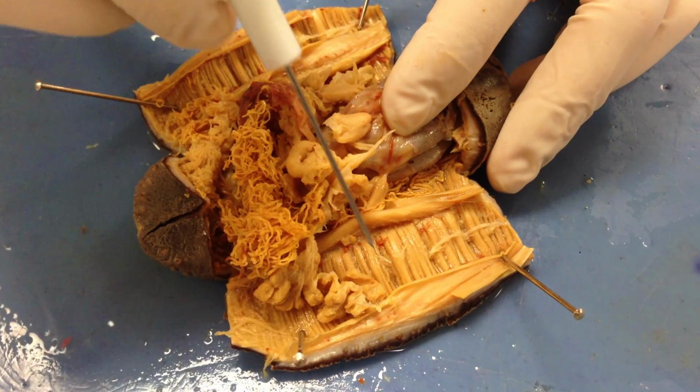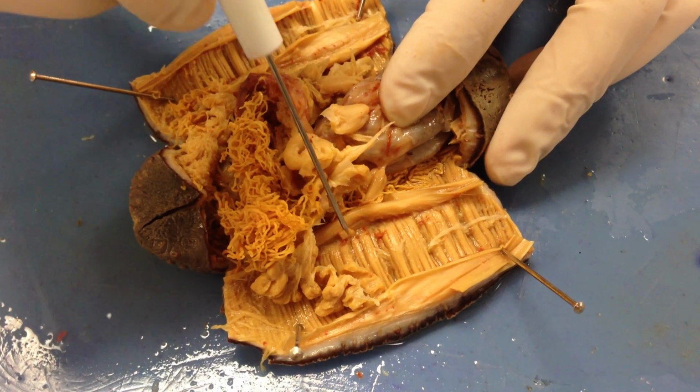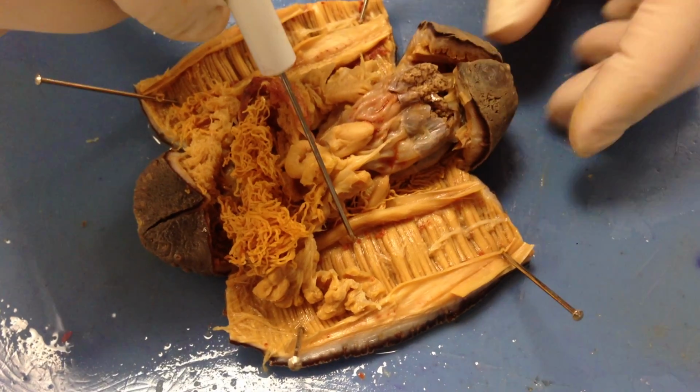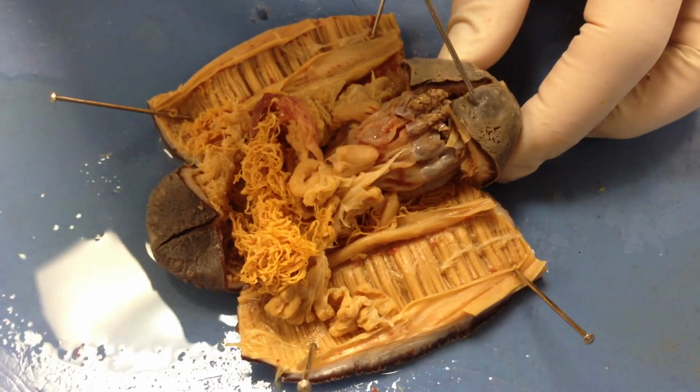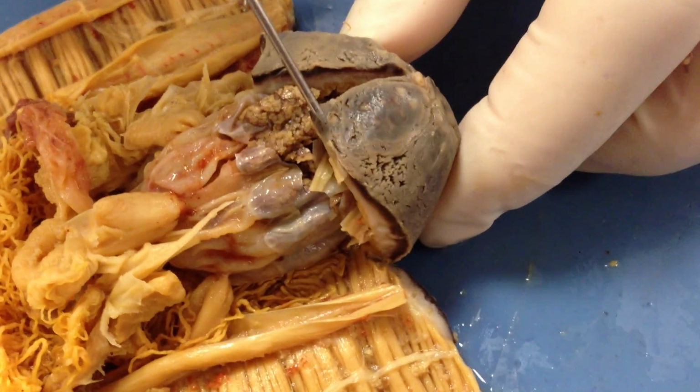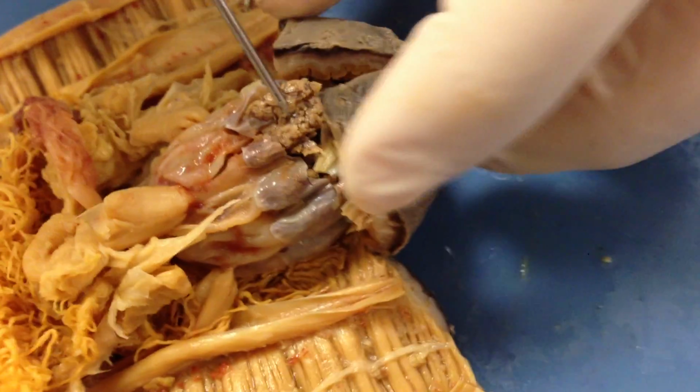You can see adjacent to the longitudinal muscles, these red little dots, those are the ampullae, which are the muscular sacs that allow the movement of the tube feet. And if you come close up here, you can see where the tube feet are essentially going to be exiting out of. There'll be the little white dots that run down your sea cucumber.